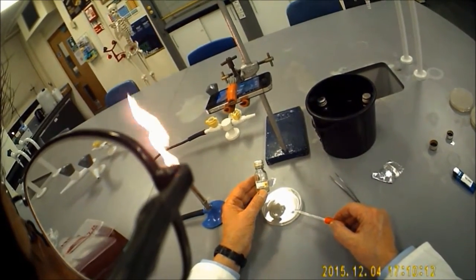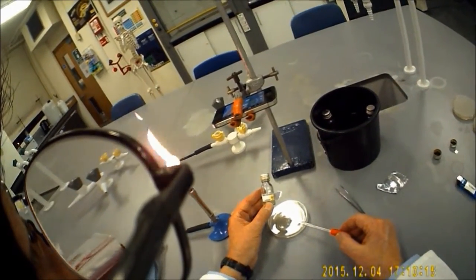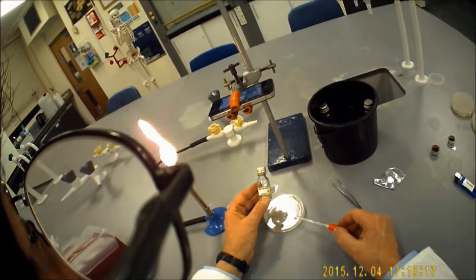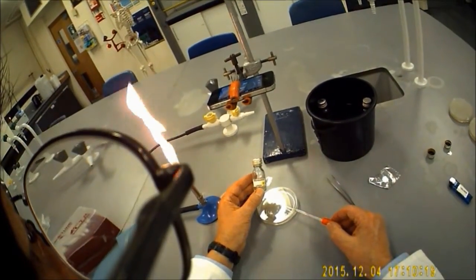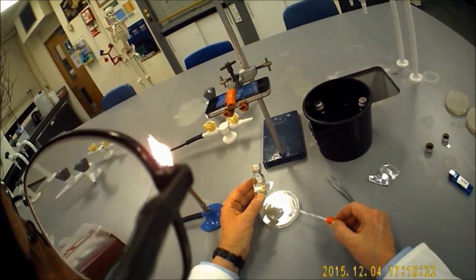We're going to see if there's any inhibitory effect either by the Micrococcus luteus on the E. coli or if the E. coli prevents any growth of Micrococcus luteus.